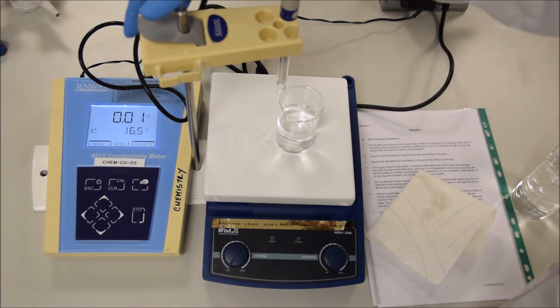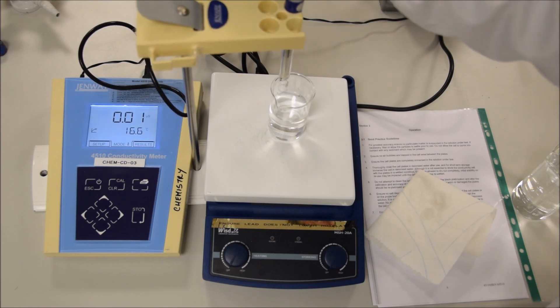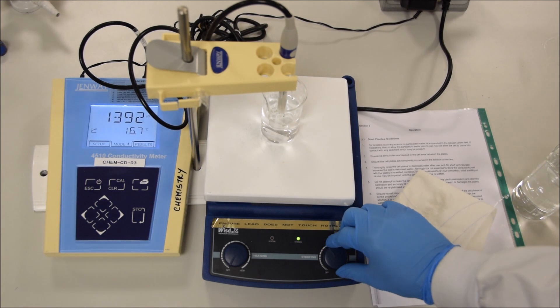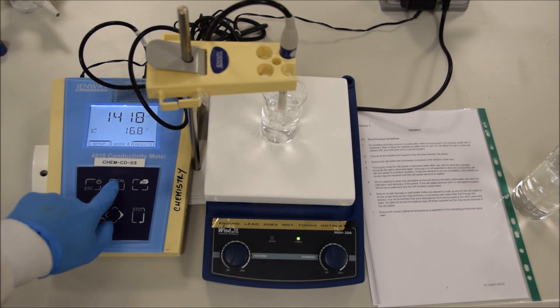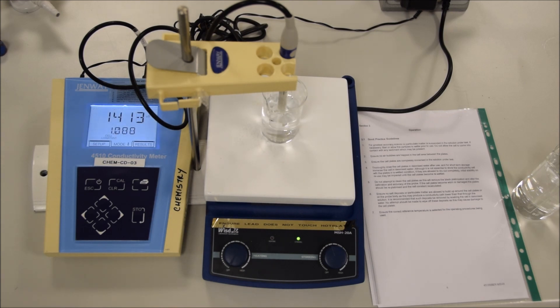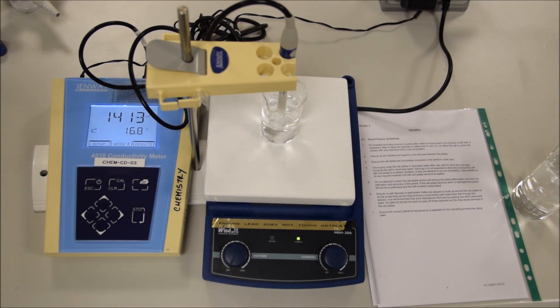You don't have to memorize it because it'll be written out on the desk beside you. So put the beaker in the middle of the hot plate and then drop the probe down in, making sure that it's at least a centimetre off the bottom. Turn on the stirring. We're going to push the calibrate button and wait for it to come to equilibrium. Equilibrium is indicated by the small icon that I'm highlighting now. Once that's set, you can push the store or return button, and that will immediately calibrate the cell to the known value for that calibration solution. That calibration solution has a conductivity of 1413 microsiemens per centimetre.